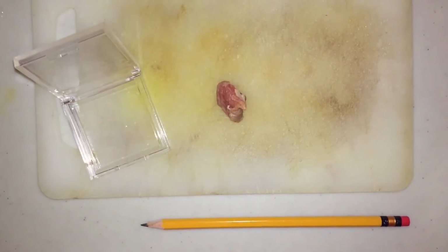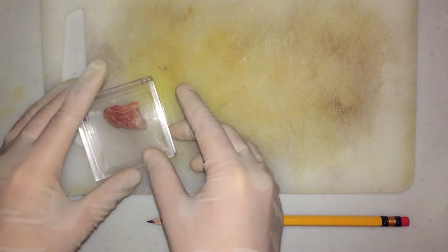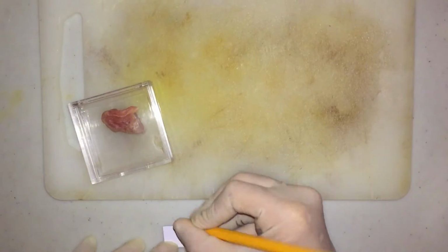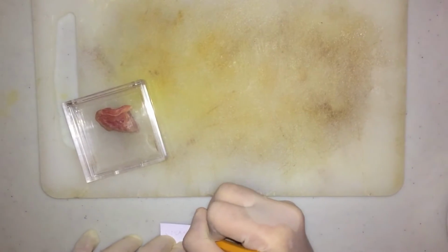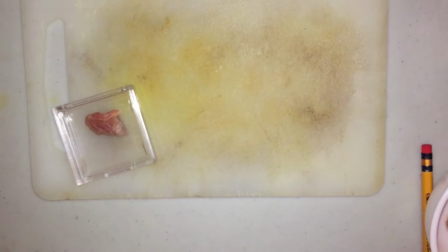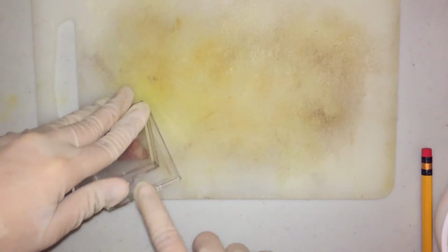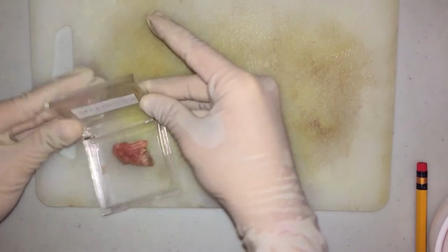After this, we will put the specimen in our tissue cassette. We need to write our name or code and attach it inside the cassette. You can also just label the plastic cassette with a pencil. Remember to use pencil in writing because it will be exposed to different chemicals, and chemicals might erase the pen's ink.